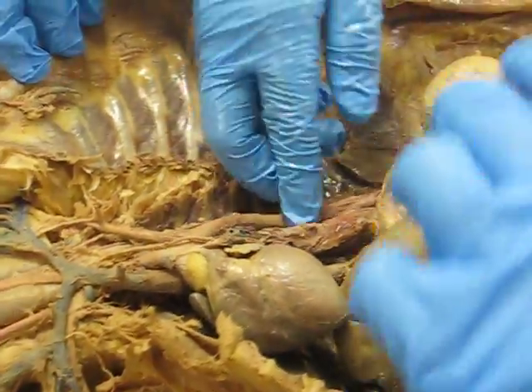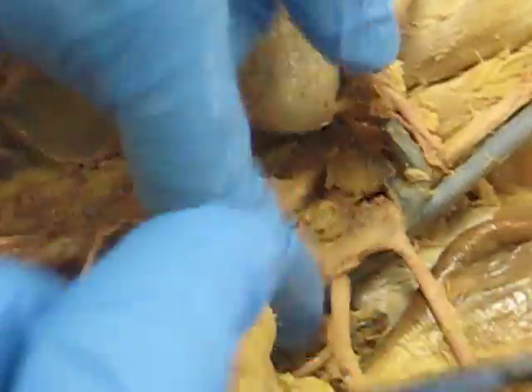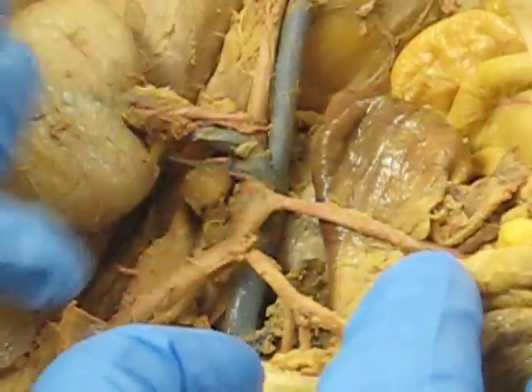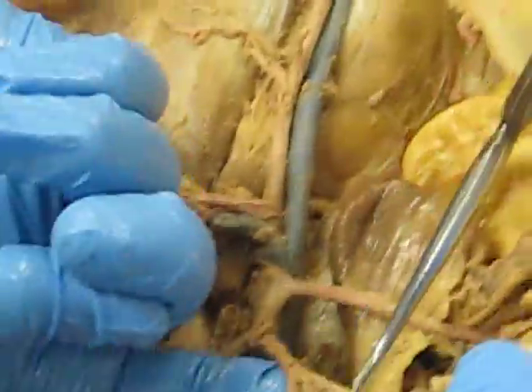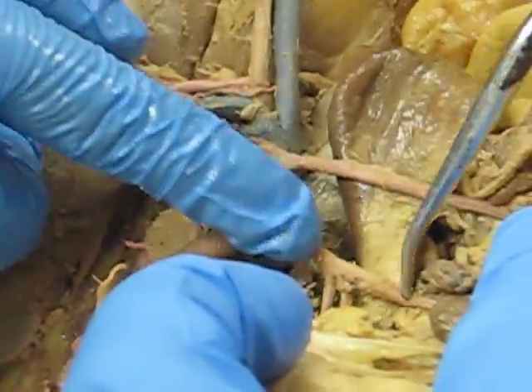From there the aorta turns into the thoracic aorta, which then transfers into the abdominal aorta. That then splits off and branches to the celiac trunk. You have three branches that come off — you have the splenic artery.